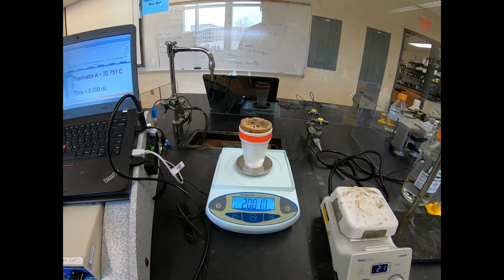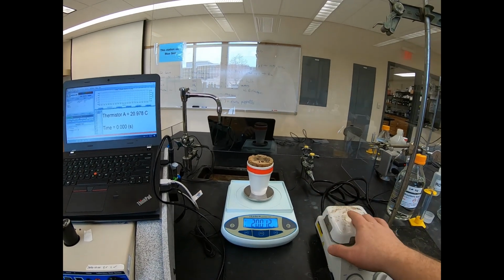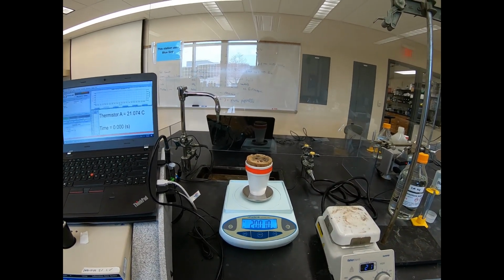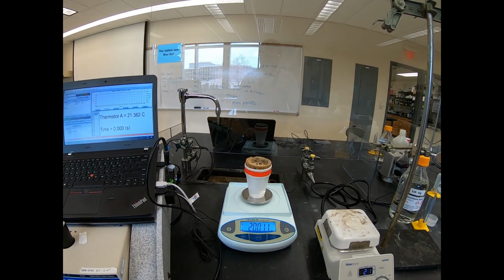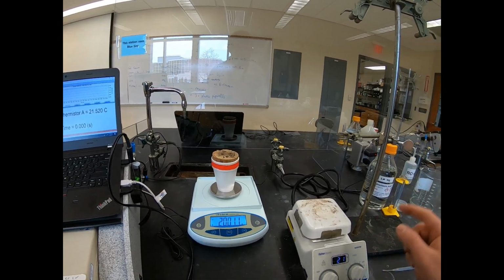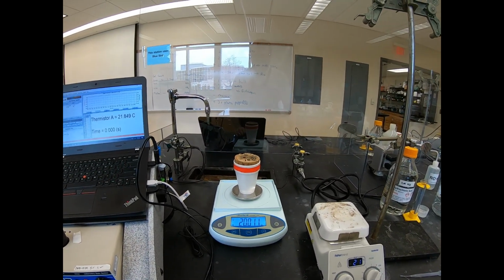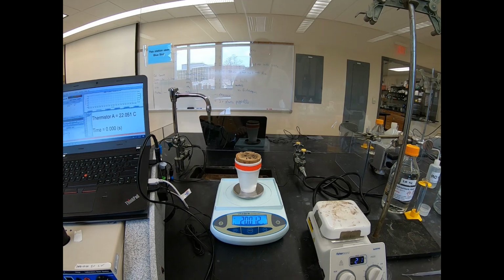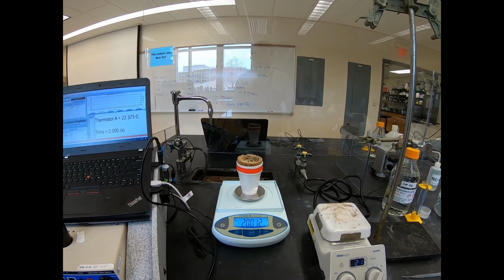All right, now this is the conclusion of our video because we now have the ability to find the mass of reactants that we had working in our calorimeter here. We know the initial and the final temperature, and we know the volume, so we can calculate the moles. So we have all the information that we need in order to calculate the delta H of reaction here. All right, on to video number 3 for trial number 2.